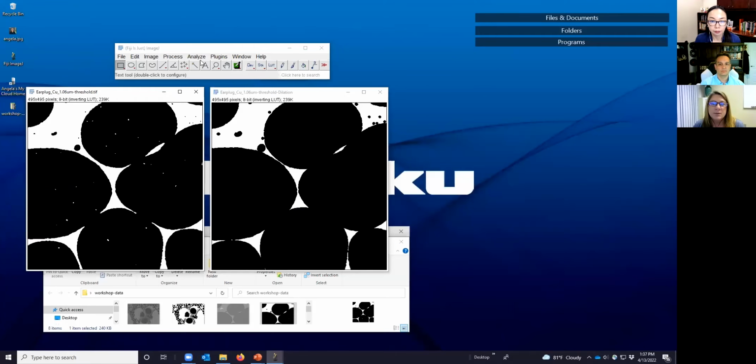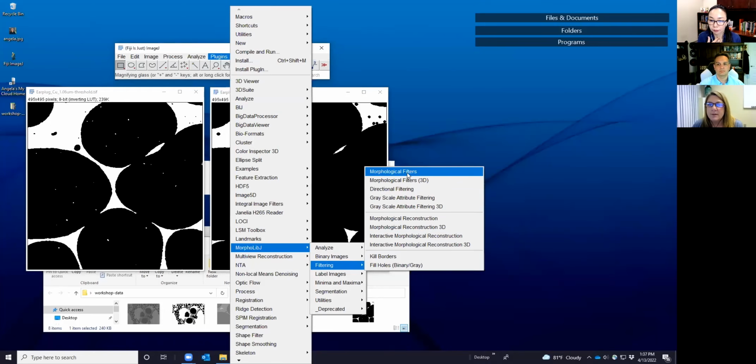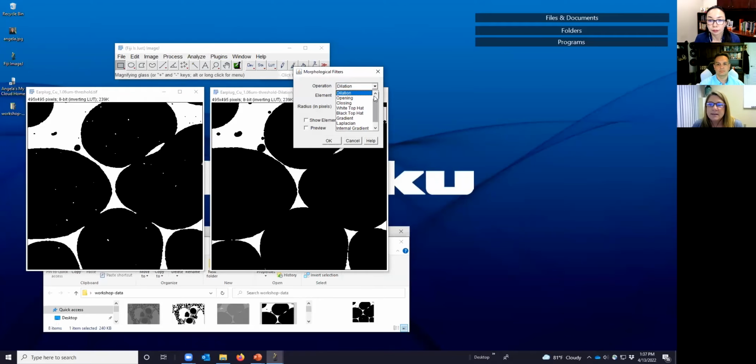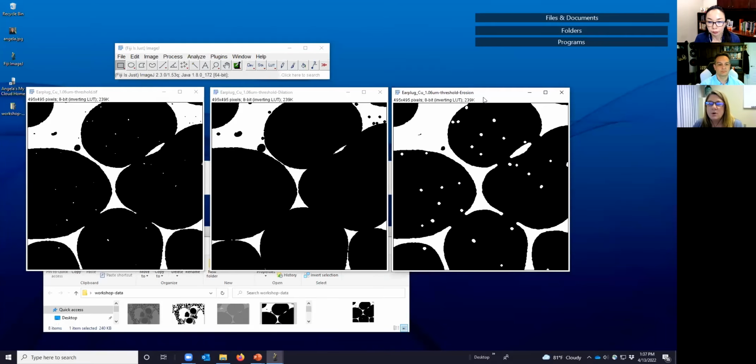Now we're going to ask, what happens with an erosion rather? We're going to change this back here, select erosion, our disc-shaped element because we have rounded voids, change this to 3, and look at what it looks like. Just like in the example we looked at before, this is exactly how I created that. In the polymer, we see that those false positives for void are now gone. However, the holes within the voids are now larger. It didn't add any holes, it just kept the same ones and made them bigger. So islands are gone in this one, and there are larger holes.